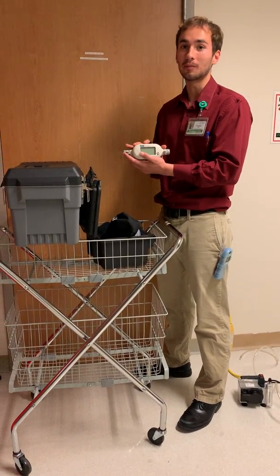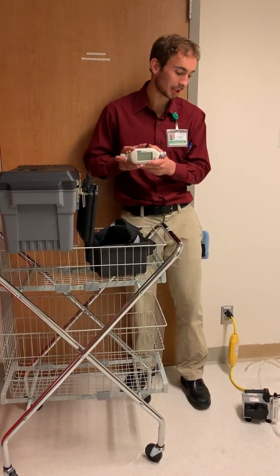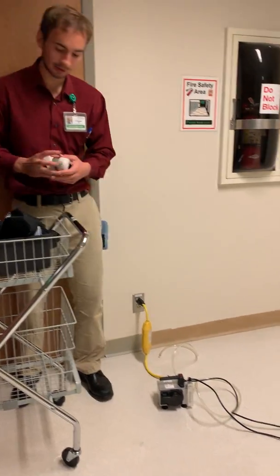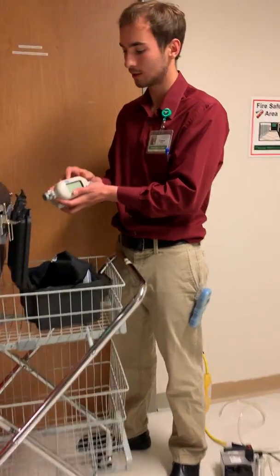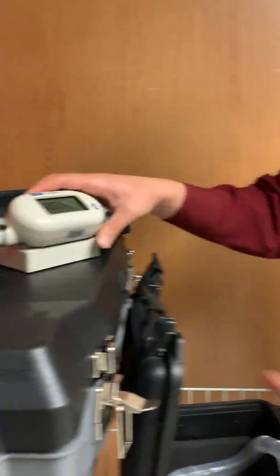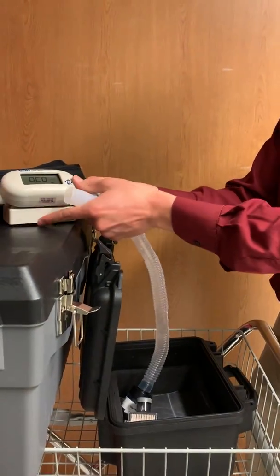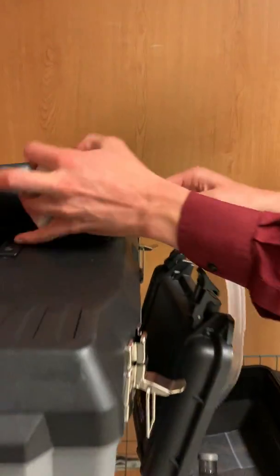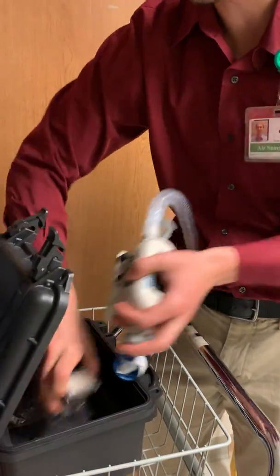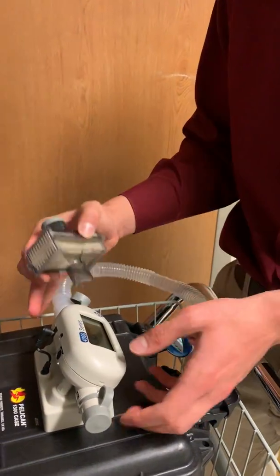Today we're going to be going over how to calibrate using a TSI calibration machine. We have our aerosol pump all set up, so first we're going to turn it on. You should have this electronic component and then a tube. Take this cover off and plug in the tube.